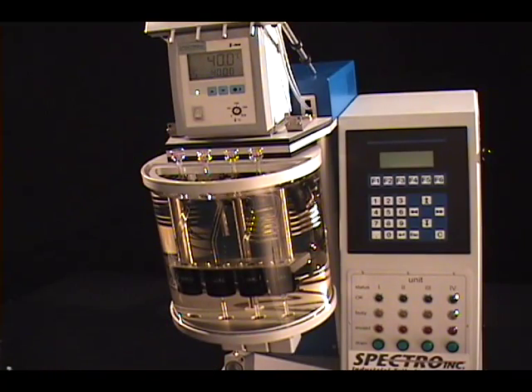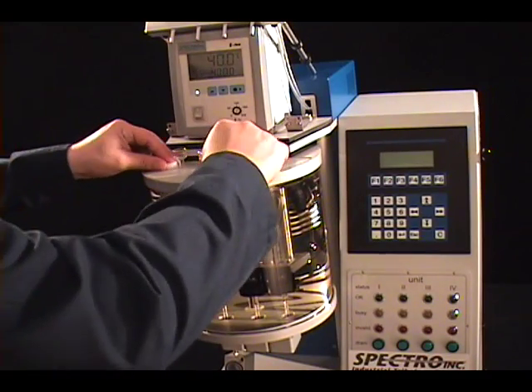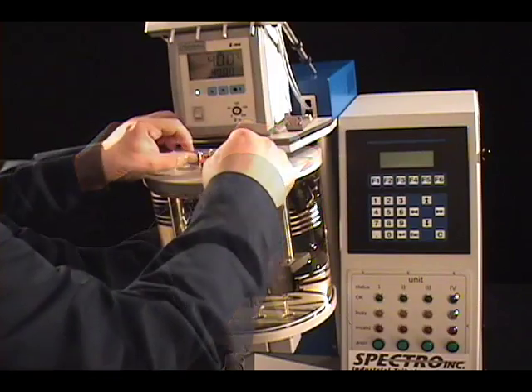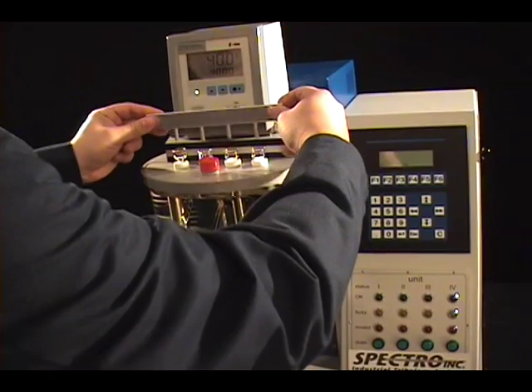Now the bath lid can be repositioned. The white spacers can be put back in place. Finally, the solvent injector can be repositioned in its holder.